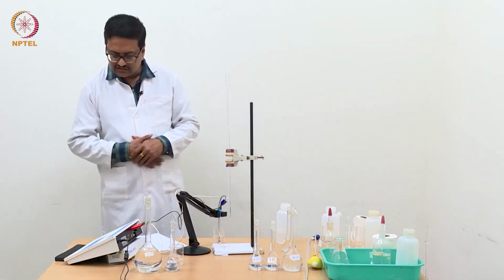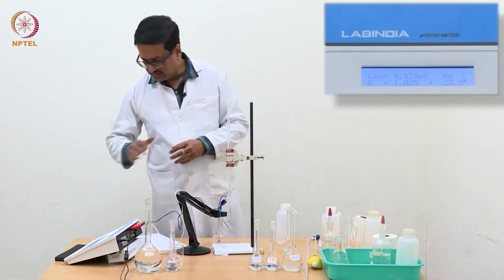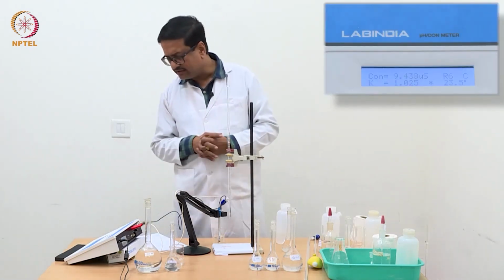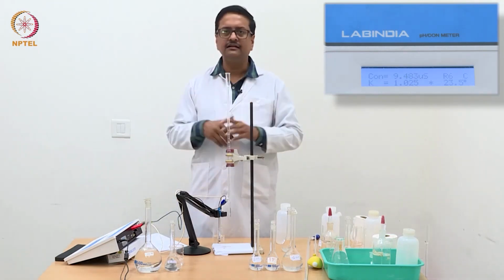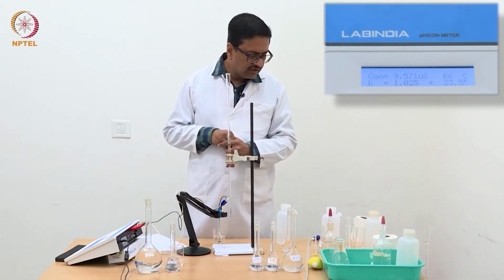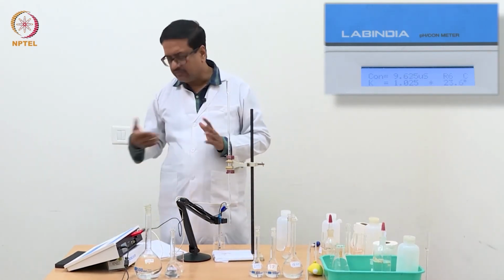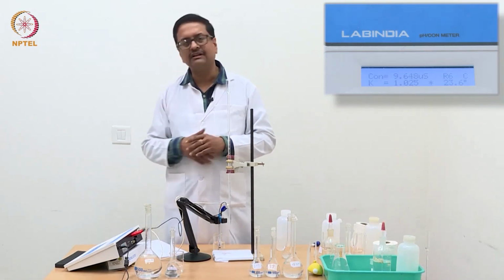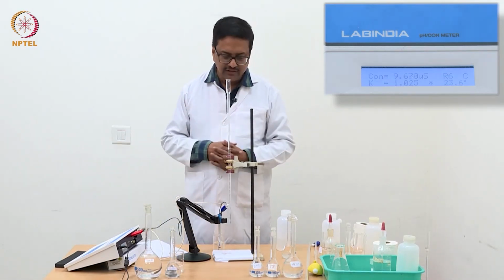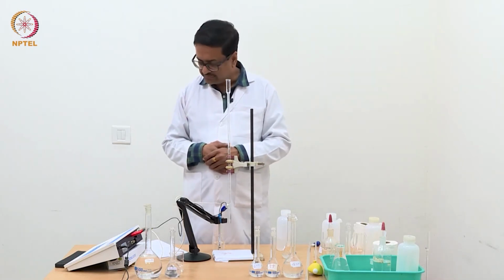So I think this is a point where we need to leave, because it's reading about 8 to 9, 10, it is all right. One can take this electrode to the lab and dip it in a little more ammonium hydroxide solution and remove. But in my opinion, if it is about 8 to 9, then I think it is fine. So we have completed the experiment of triple mixture.